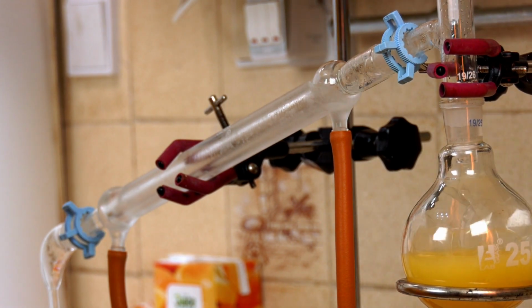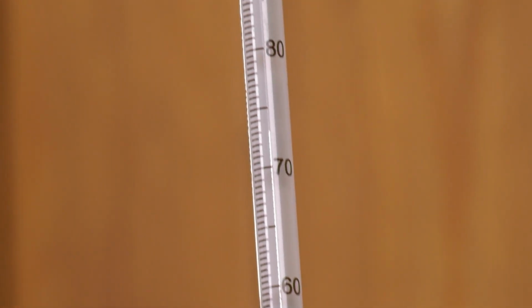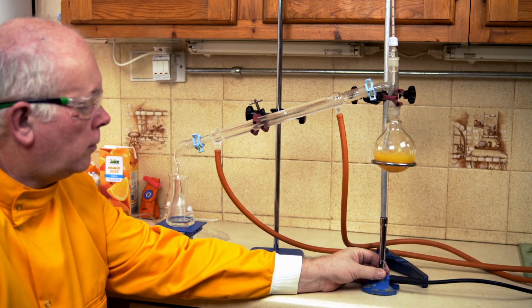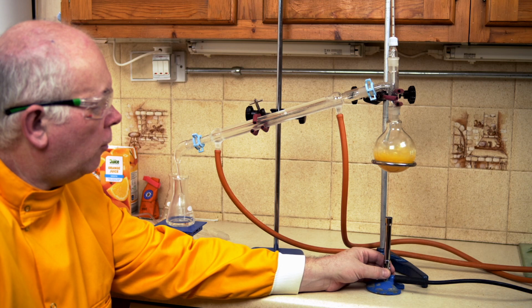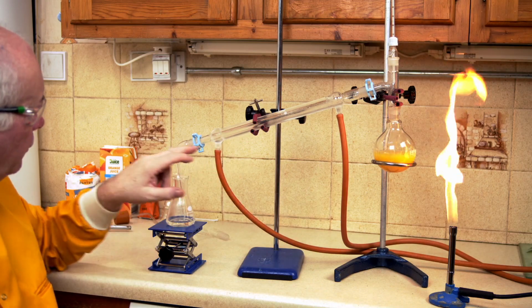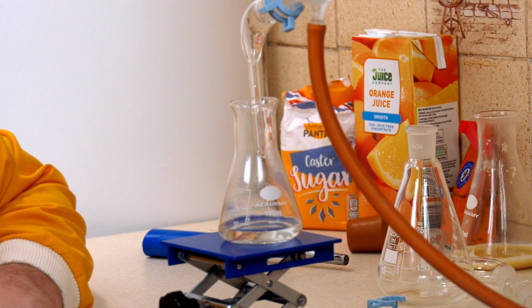We can look at the temperature here and we can see it's about 85 at the moment. Now that's above the boiling point of alcohol, and so some people think it's immediately gone wrong. But in fact, when you've got other substances mixed in, then we often get boiling point elevation. So this is about right. And we can see the alcohol coming down here and dripping into this conical flask.